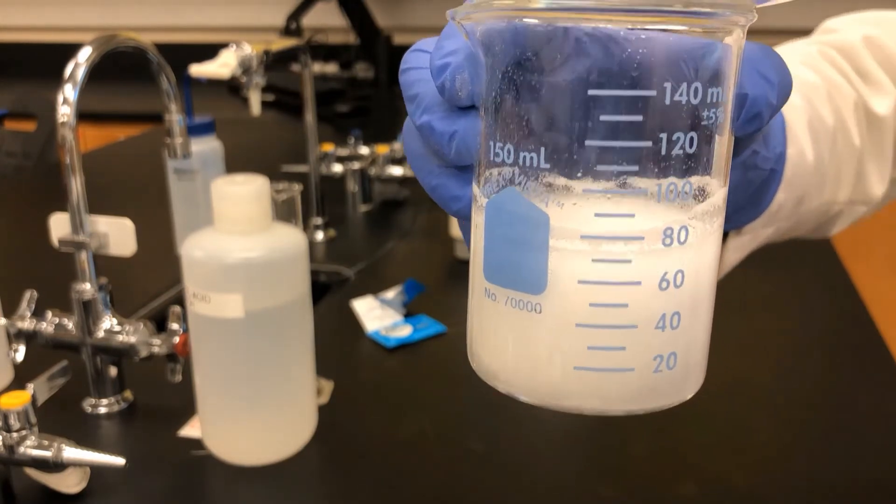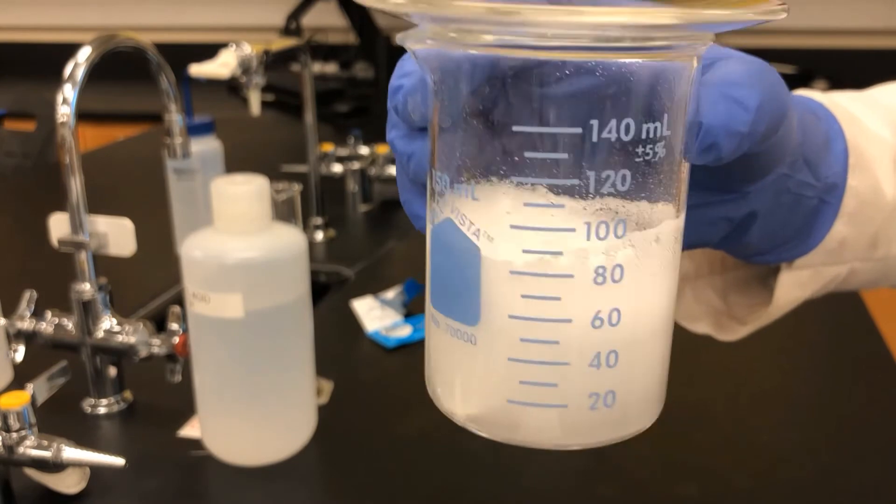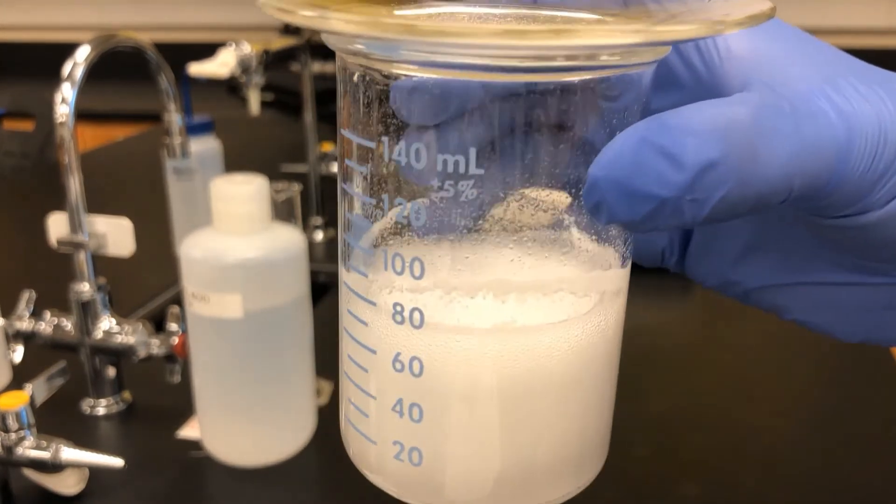One observation we can make is that the Alka-Seltzer tablet reacts for a longer amount of time than the pure sodium bicarbonate.